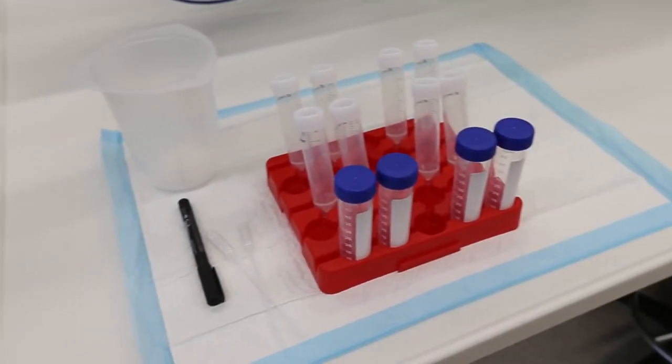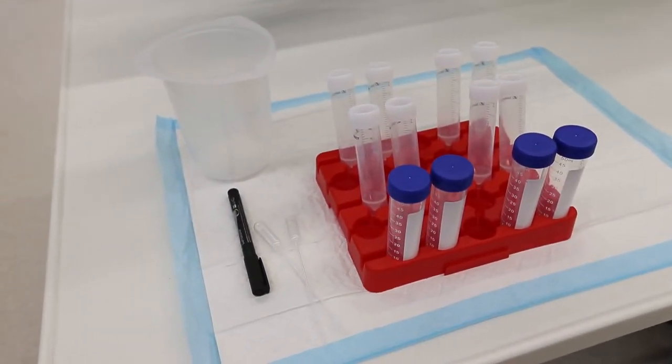In this video, we will demonstrate how to take a urine sample for use in this practical class. You will take four samples altogether.